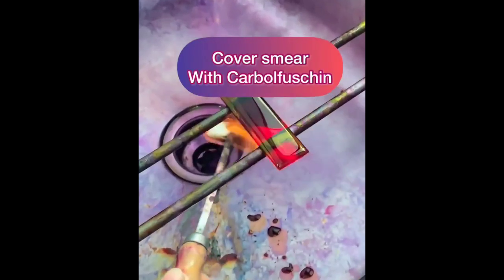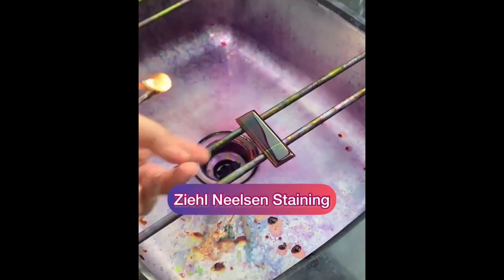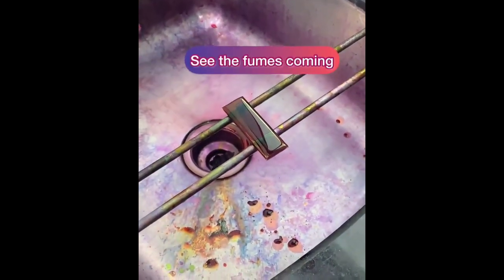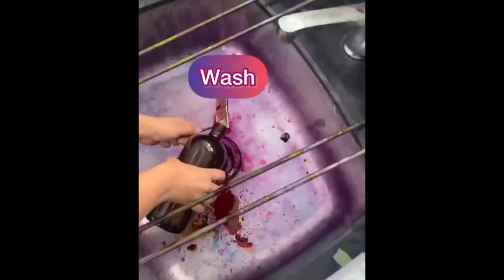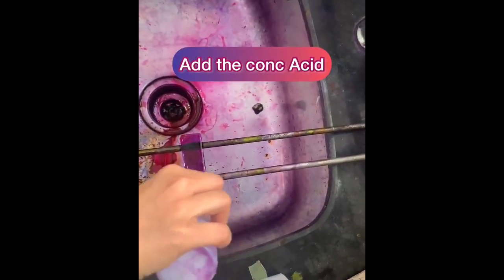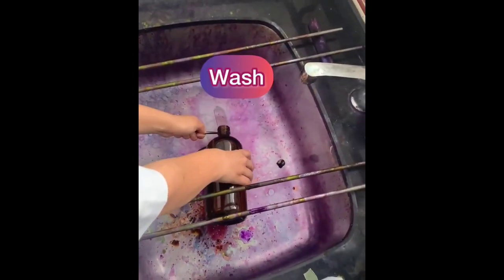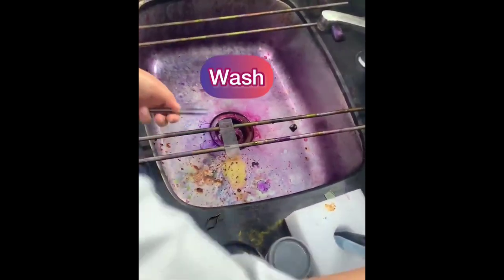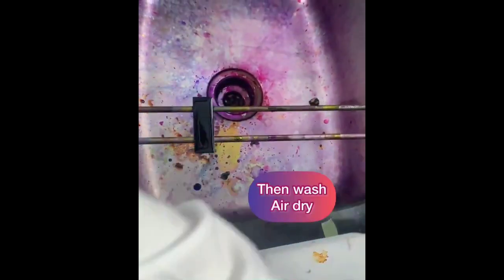Cover the smear with carbol fuchsin and heat it, but do not char — be careful and watch for the fumes. Now wash it with distilled water, then apply the decolorizer. Again wash with distilled water, then stain with methylene blue.